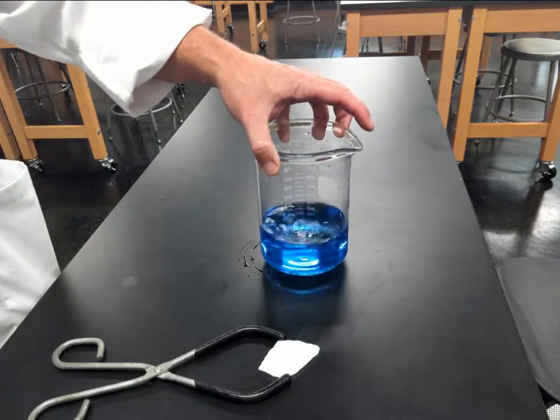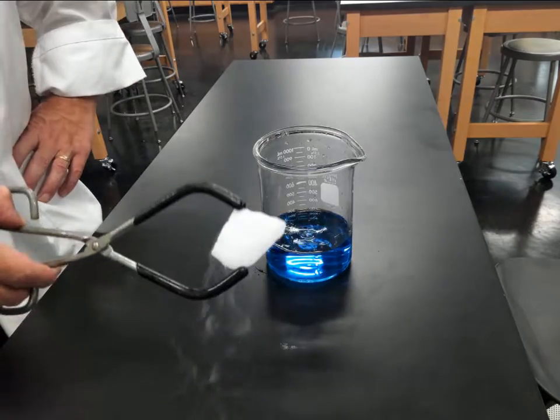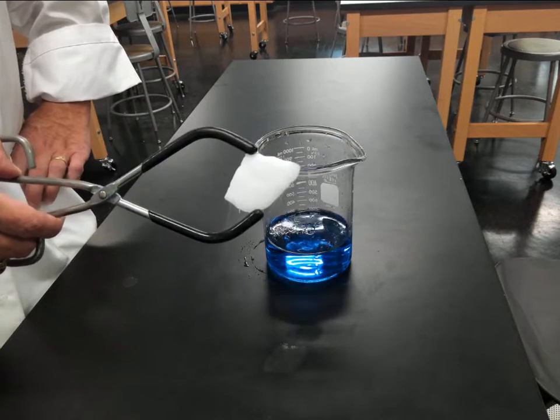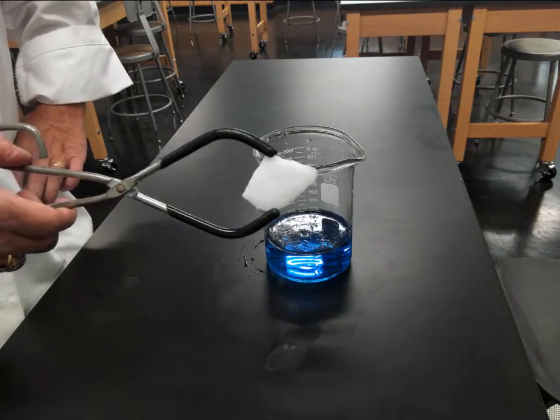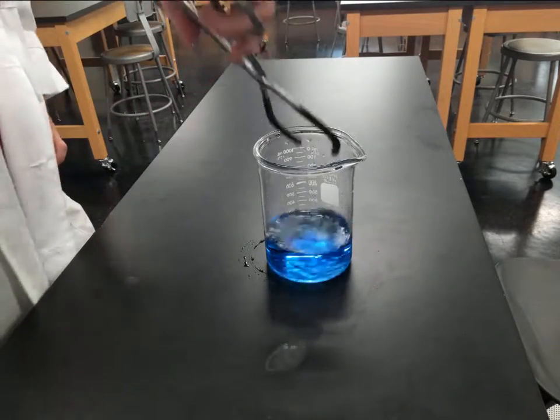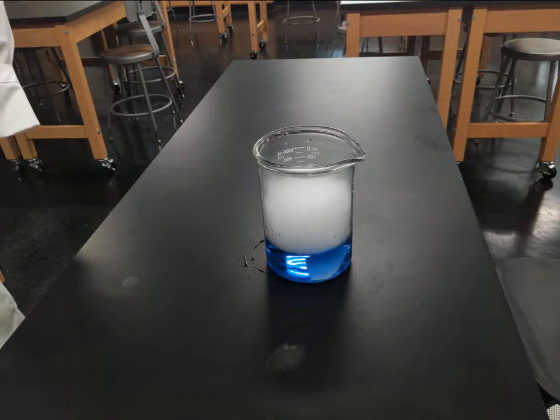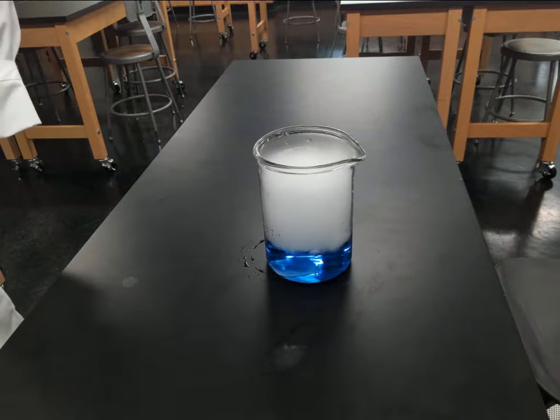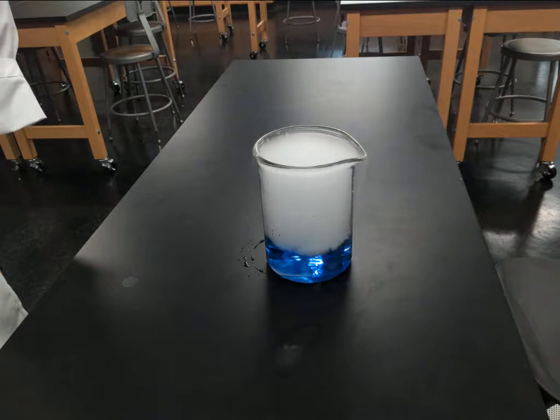Now what I'd like to do is neutralize this base by adding our solid CO2, our carbon dioxide. And when we add this to our solution, we're going to start making carbonic acid, and it should neutralize that blue solution. So we'll see what's going to happen. So now we have our CO2 bubbling in the water. We're in the process of making carbonic acid. It is going to neutralize that base. So eventually our blue color should turn yellow once this becomes acidic.